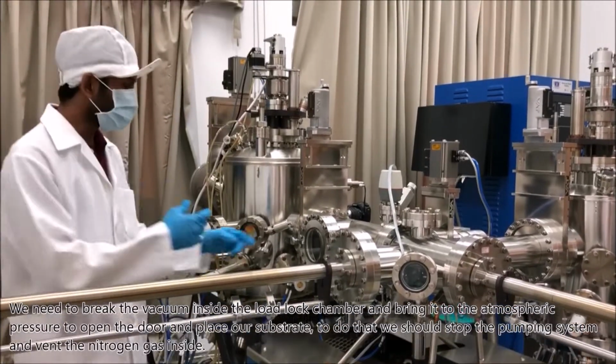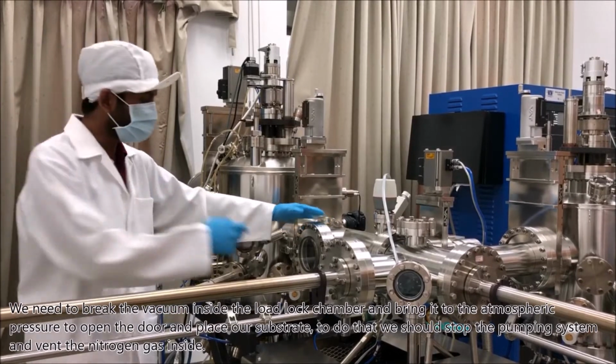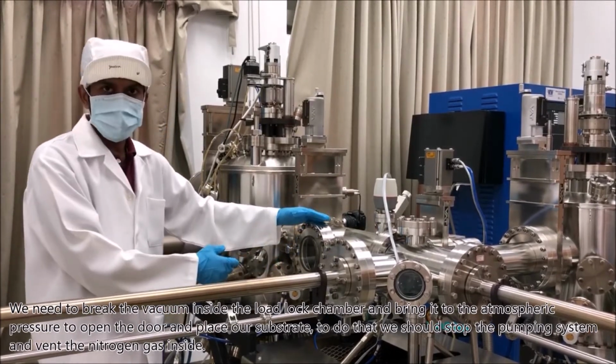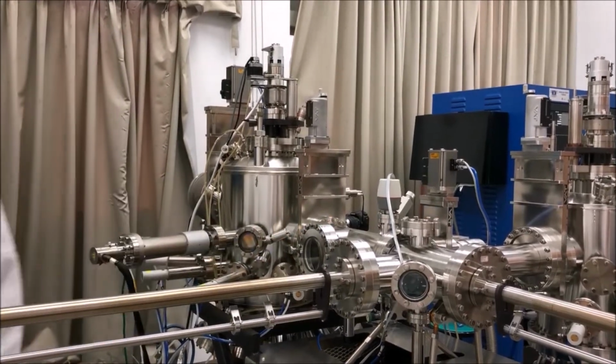We need to break the vacuum inside the load lock chamber and bring it to the atmospheric pressure to open the door and place our substrate. To do that, we should stop the pumping system and vent the nitrogen gas inside.